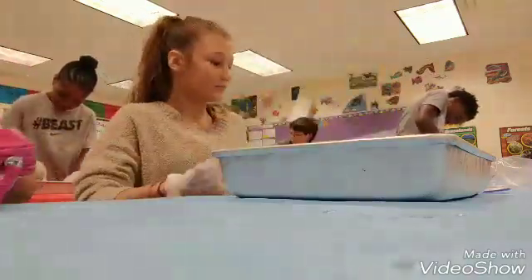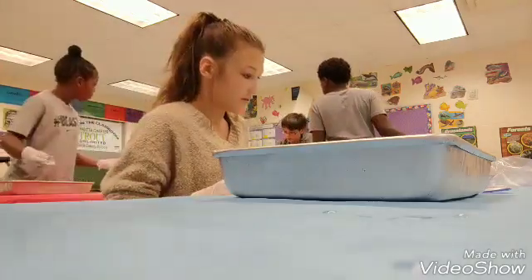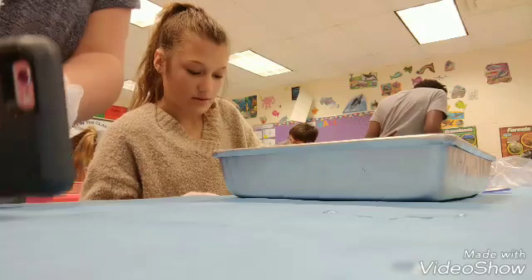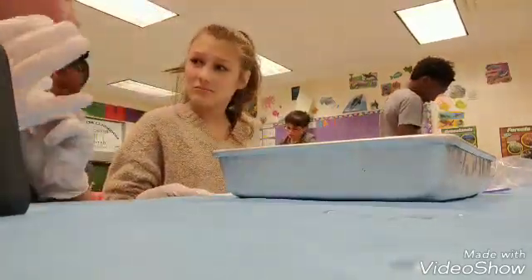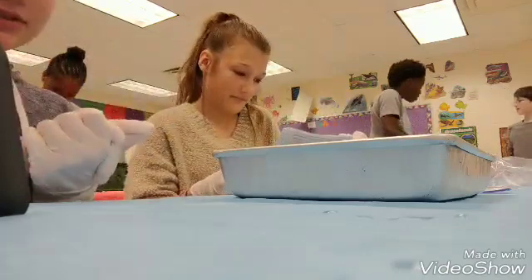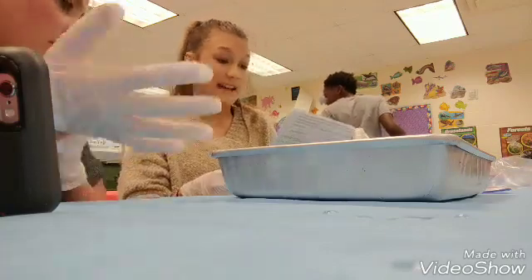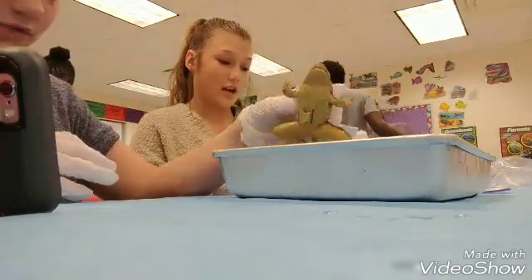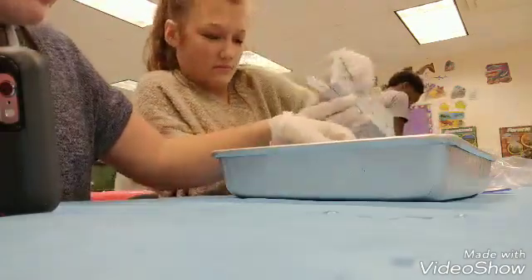Okay, so the next thing we have to do is... Don't we have to do the legs? I took it the wrong way. We're going to need a... What page were we on? What did you find in the stomach? Remove the small intestine from the body cavity, and carefully. It's like... small intestine. So, should we pin him to the ground? Sorry if you can't see very well. I need a tripod. Miss Holder, do you have a tripod? Our teacher is super nice — she's letting us film the vlog.